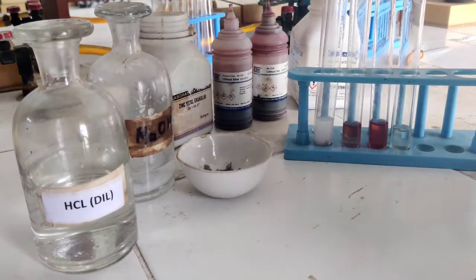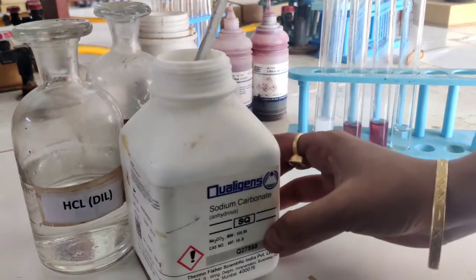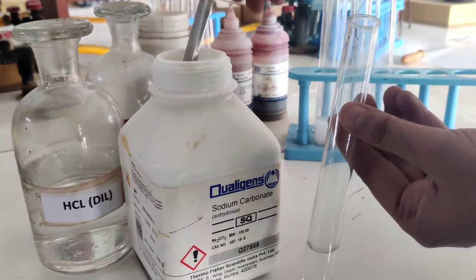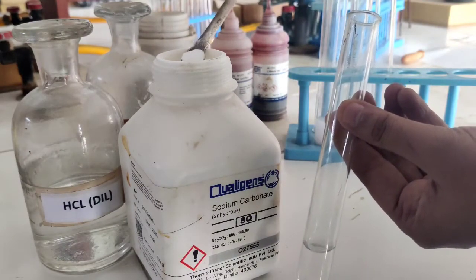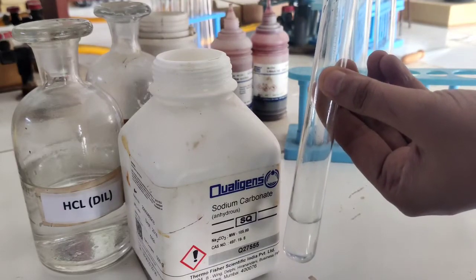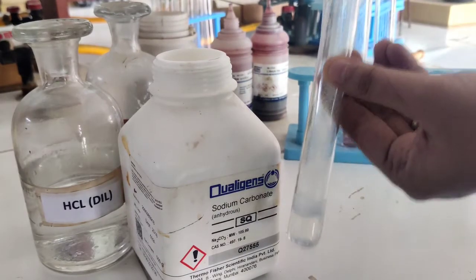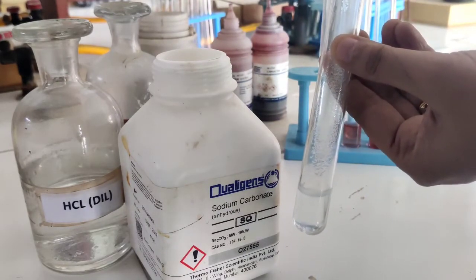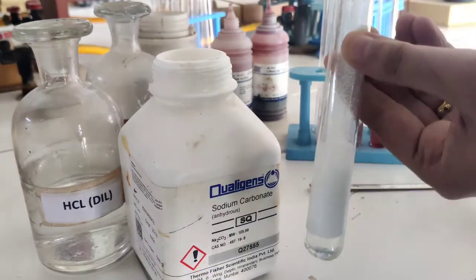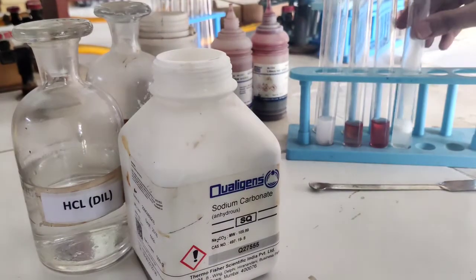The next reaction is the reaction of sodium carbonate, that is Na₂CO₃. We add solid sodium carbonate into the dilute HCl, and there will be an evolution of gas. This gas is obtained with a fizz sound — it is carbon dioxide gas which is released as soon as we add solid sodium carbonate into it, releasing CO₂ gas.